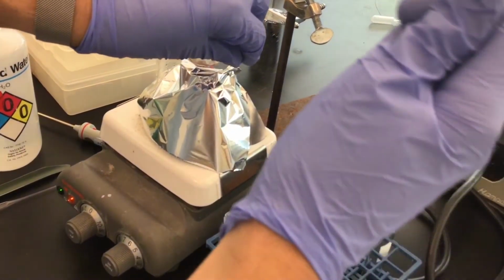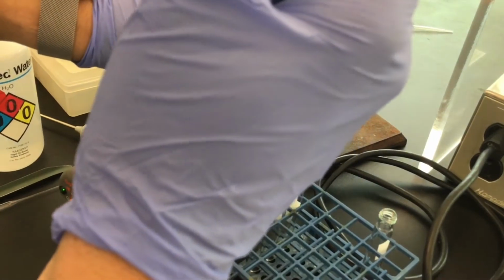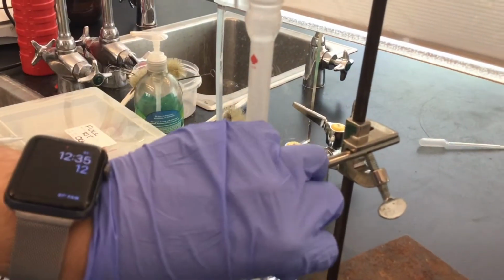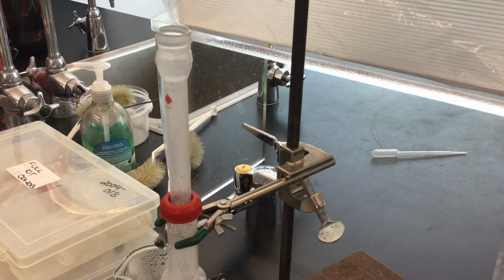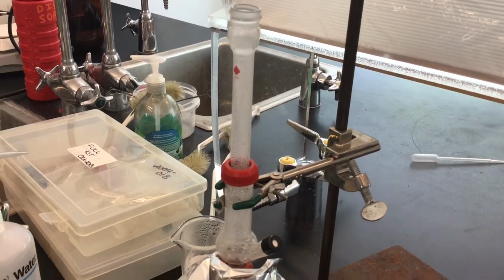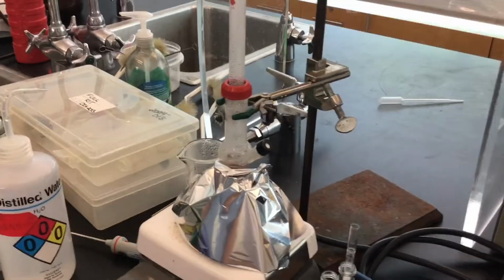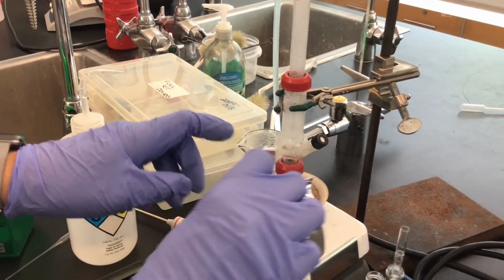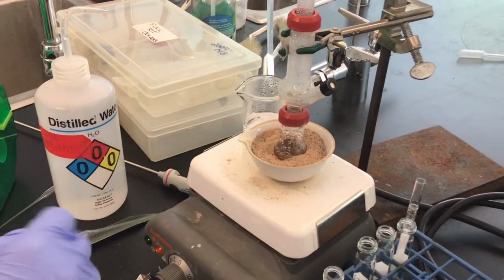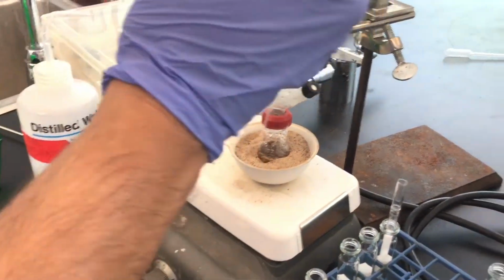All right, so we're doing a great job. We can also see now at this point that the steam has reached the air condenser. It's gone all the way up here, and to both of us, it's smelling very cinnamony in here. But remember that I said we wanted to maintain the volume down here below because we don't want to burn the bark or just heat it to dryness.